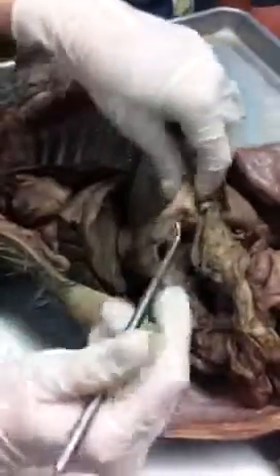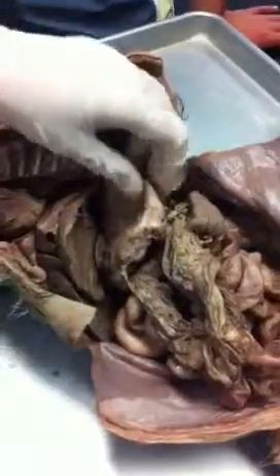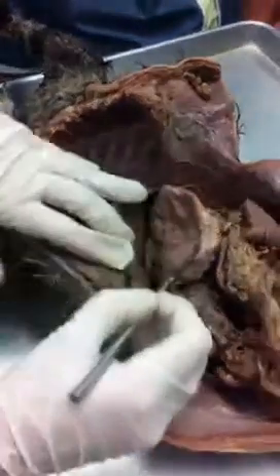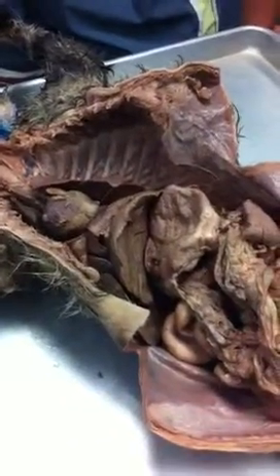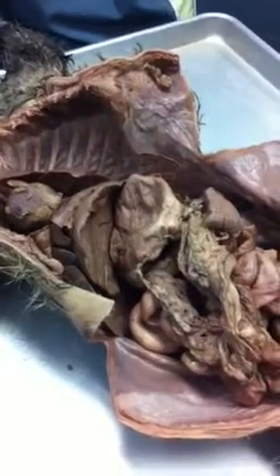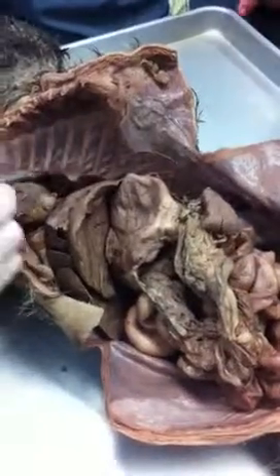Inside the stomach, there are folds in the stomach. What are those called? Anybody know? Rugae. Very good. They're folds. What is it? Rugae. R-U-G-A-E. Excellent. Okay, what valve does not close if you have heartburn? The cardiac sphincter or the gastroesophageal sphincter? Okay, excellent.